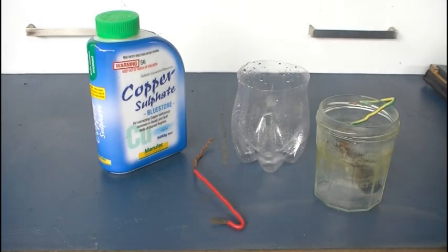Hi guys, Harry here. Welcome to Scrap Science. So today I thought I'd show you a quick and easy method of generating sulfuric acid, seeing as it's kind of difficult to get hold of.